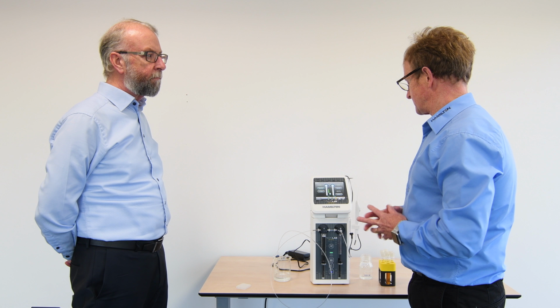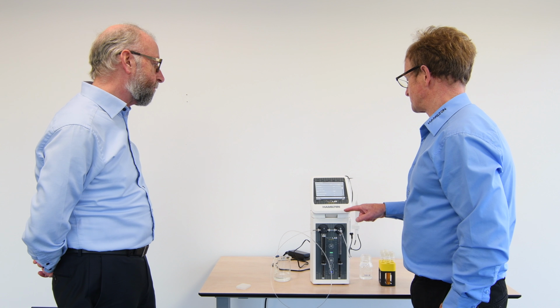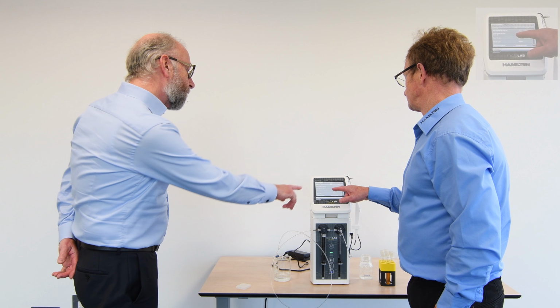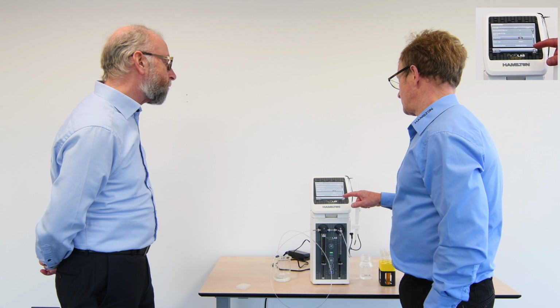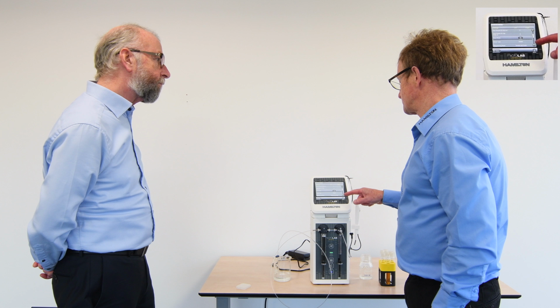So if we go back to that advanced programming step that we looked at earlier, I can look into this program. One of the things you may have noticed is we have a wash mode. The wash mode is switched off at the moment, but if I select this, it's initiating part of the program to put a further wash step at the end of the run. So you can see the wash mode is on, the function is here now, and if I go back into the program, we have an option here to put a wash volume. You see another little tag has come up.